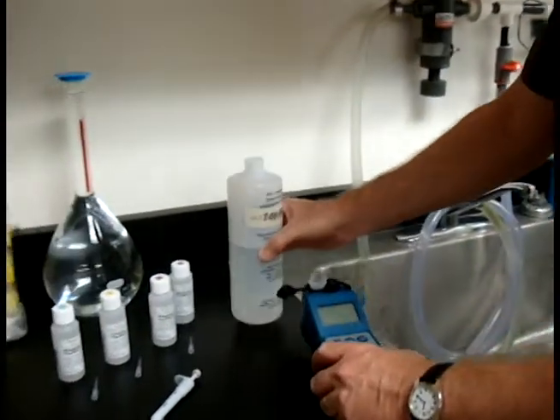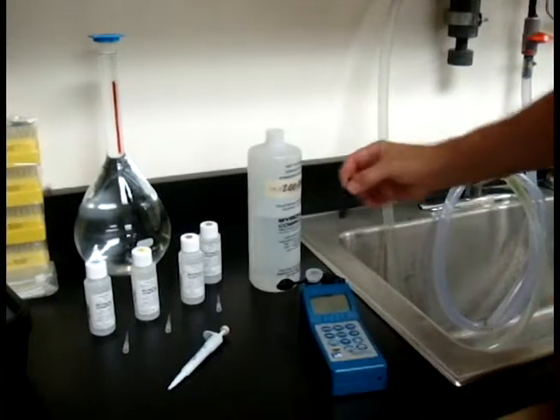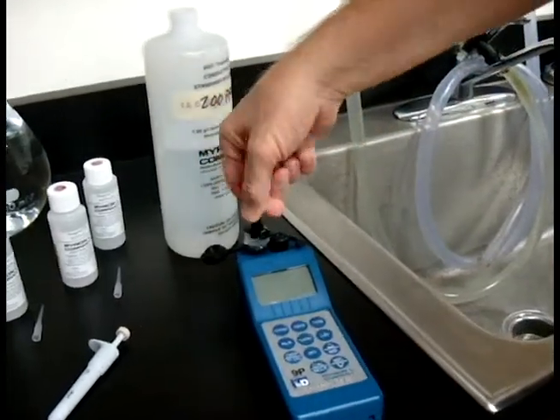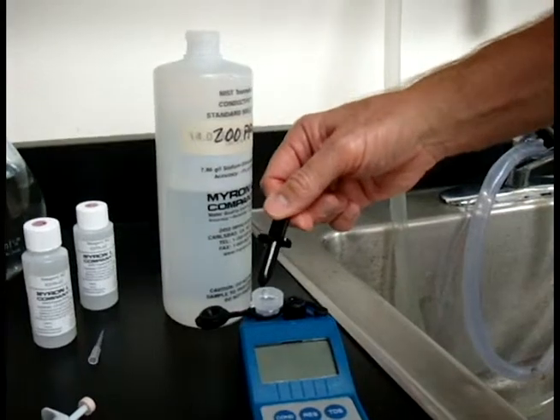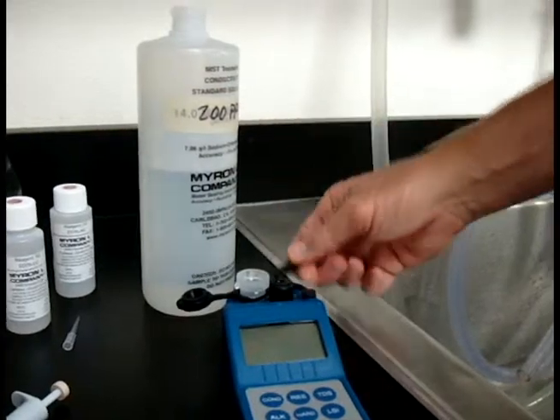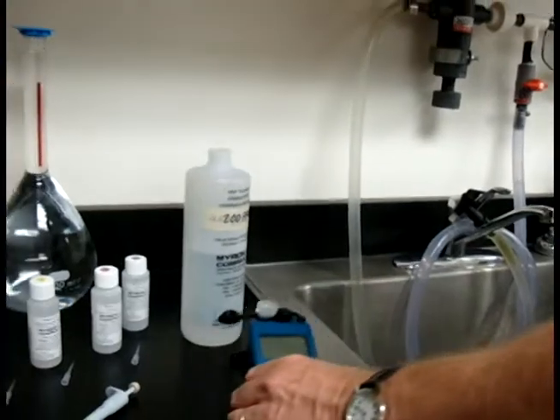Make sure your T-plunger has been cleaned, then go straight down to displace the solution. Give it a couple of twists, then tap it to remove any excess on the end of the plunger. Come over to the sink and get rid of your excess out of the well.